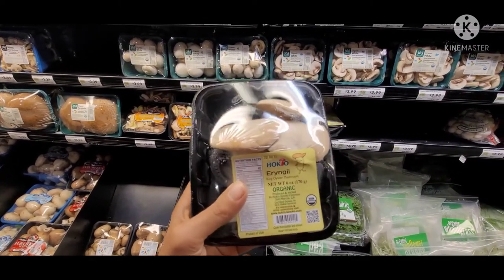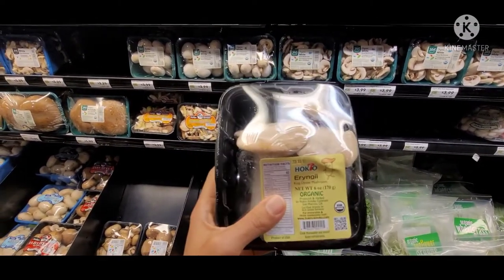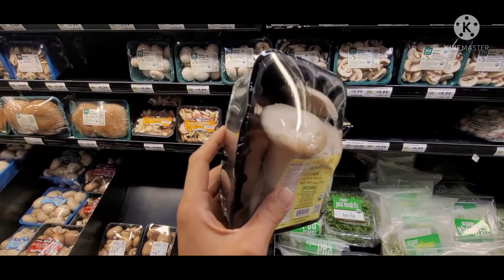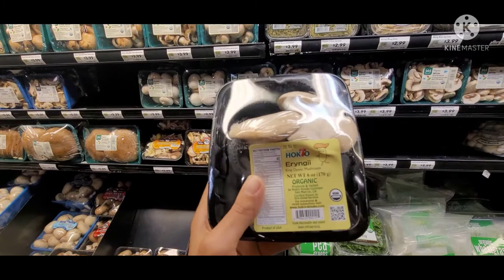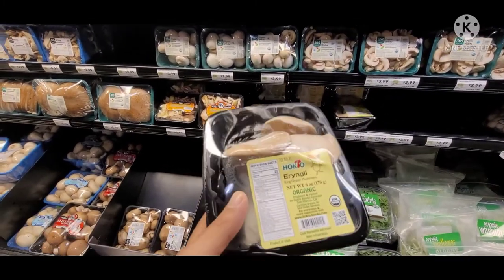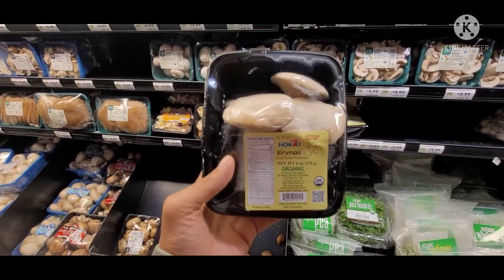We're gonna get the tissue sample first, and then of course we're gonna destroy these by cooking them and eating them.